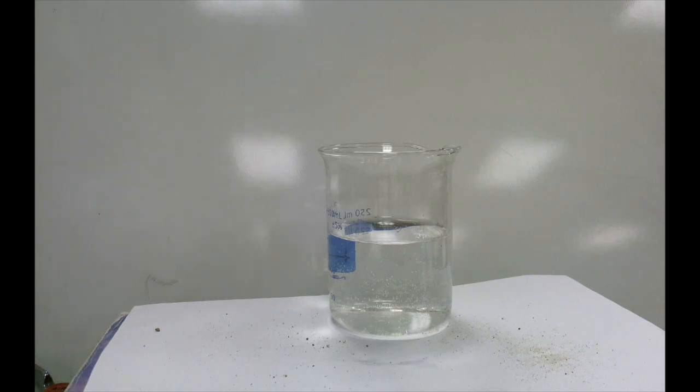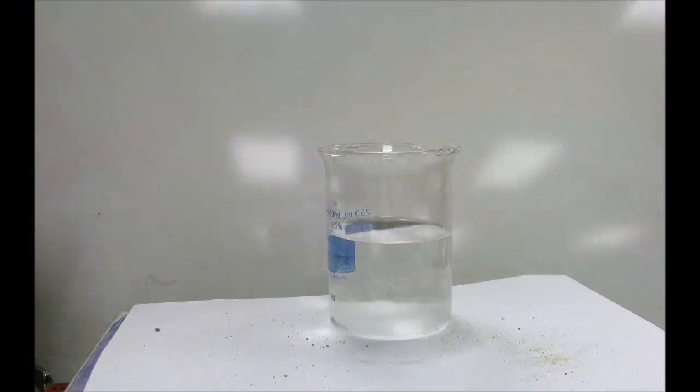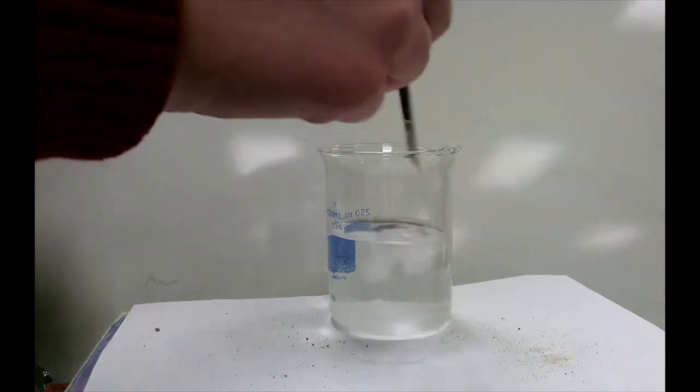Now you'll want to turn to the second page of your worksheet because we're going to look at our next combination of substances. So here on the table again, I have another beaker of water. Now to our beaker of water, we're going to add some salt. And once we've added a decent amount of salt, we're going to stir to dissolve the salt.